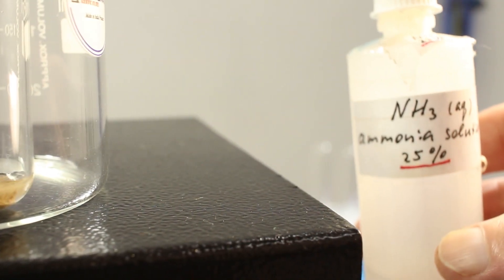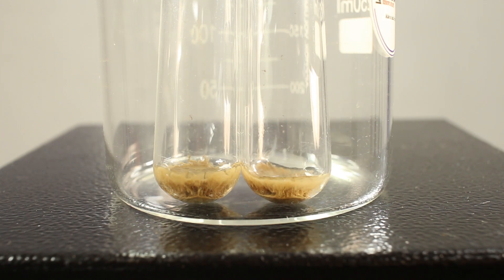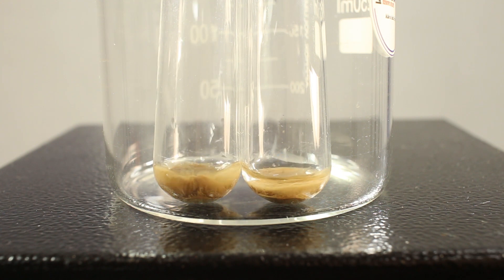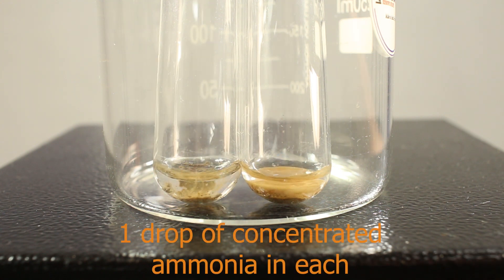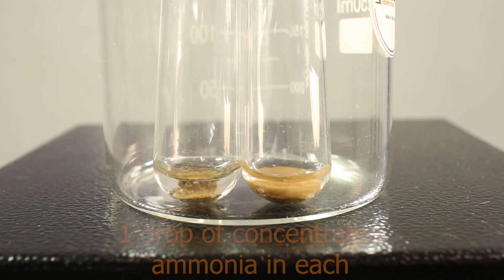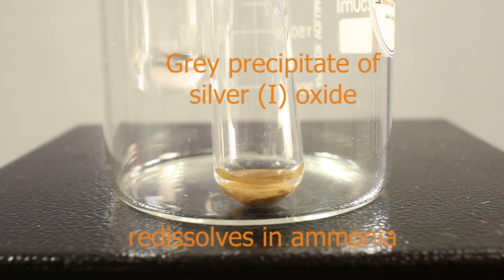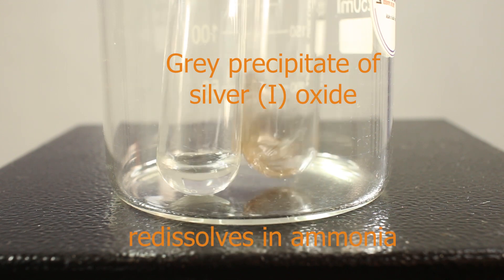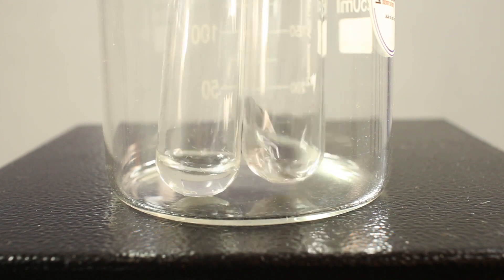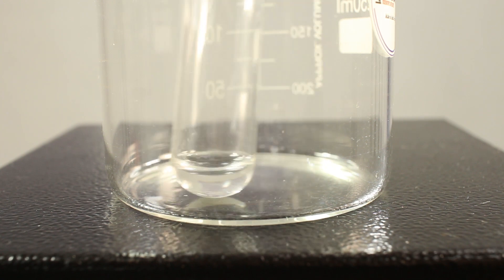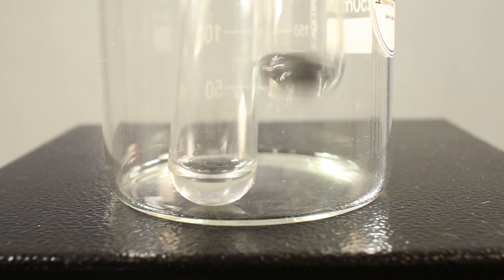And that we deal with ammonia. It's supposed to form complexes, redissolving silver ions back again. Silver ions are going to work as oxidizing agents in Tollens reagent, acting on reducing aldehydes. OK, with a little bit of shaking, our Tollens reagent is almost ready, last bits disappearing.